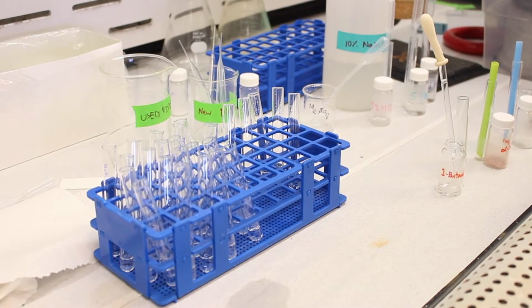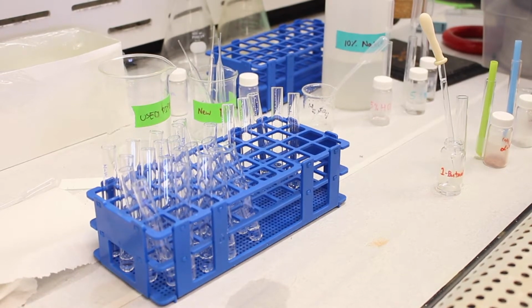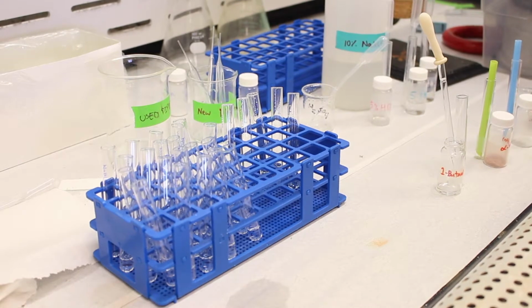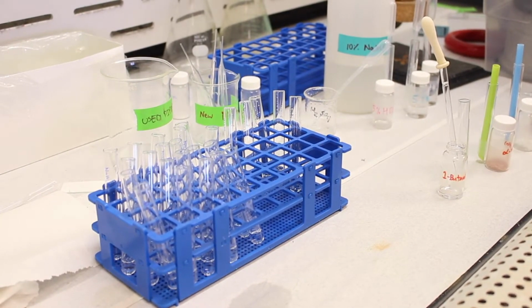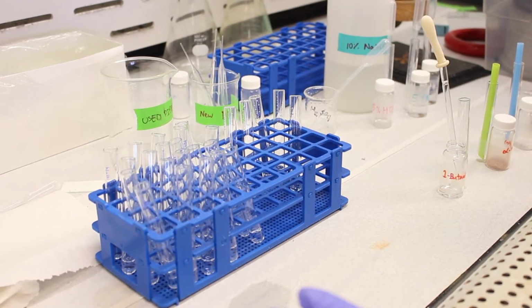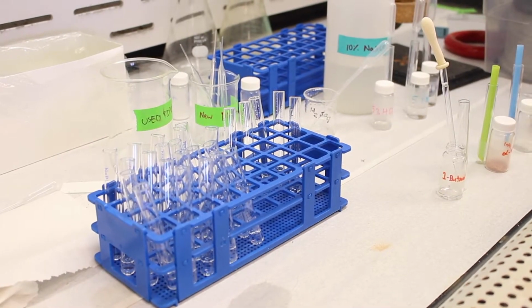but we're going to use a different technique, and this time we're using a wet lab technique to test the solubility of an organic compound. Now, most organic compounds tend to be very lipophilic, so think oil or cooking oil, and they don't dissolve very well in water, at least at room temperature. So we can exploit that phenomenon and we can examine organic molecules in terms of whether or not they're soluble.